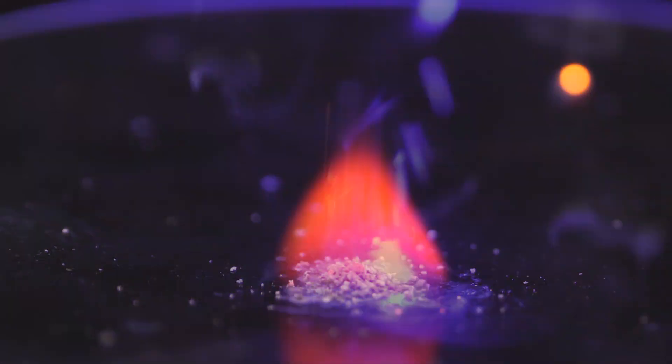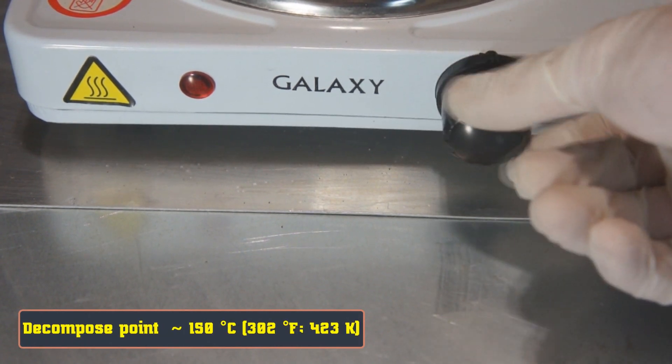Let's see what will happen with Lithium Aluminum Hydride under the laser ray. When it touches the surface with a temperature of more than 150 degrees Celsius, it instantly flares up.